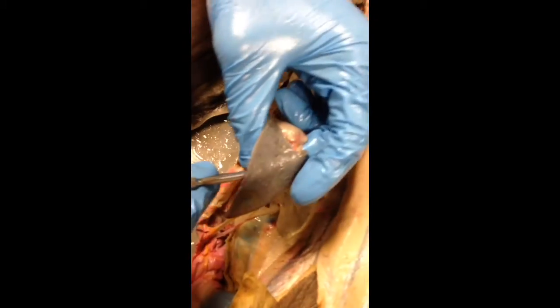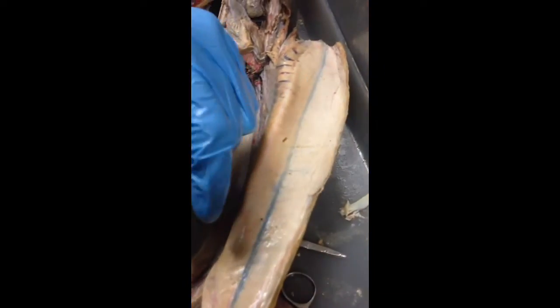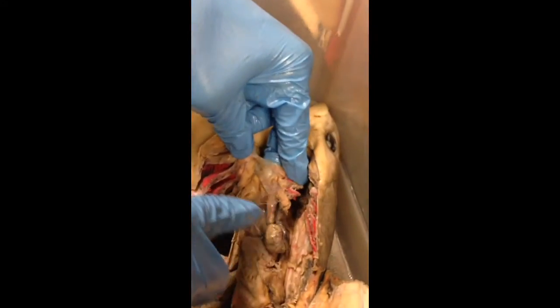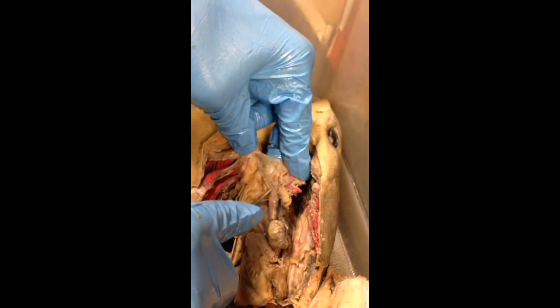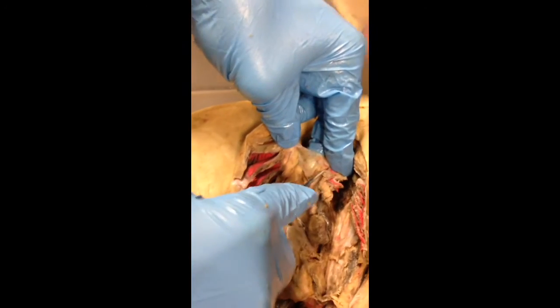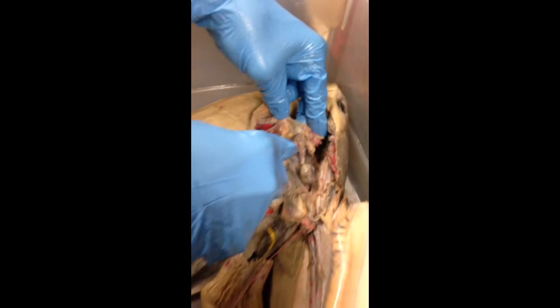Next thing is the spleen. Very easy to differentiate — it's a silverish color tissue, a flap of tissue. Next thing on the list is the afferent branchial artery, and that connects from the conus arteriosus through the ventral aorta and then to the gills. And that is the anatomy of the shark.